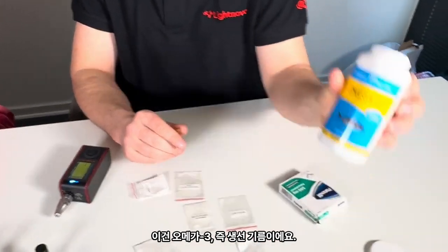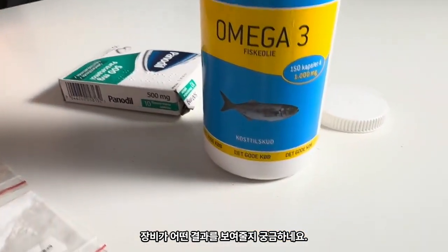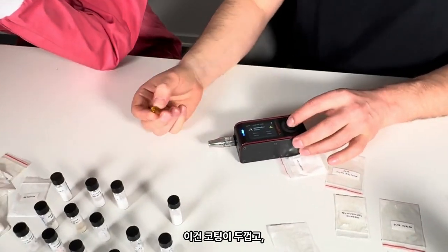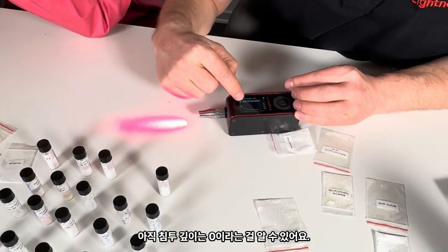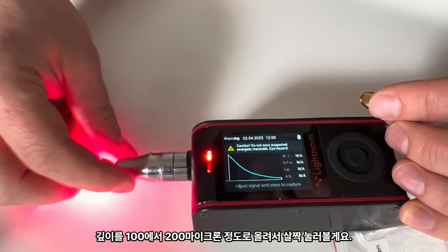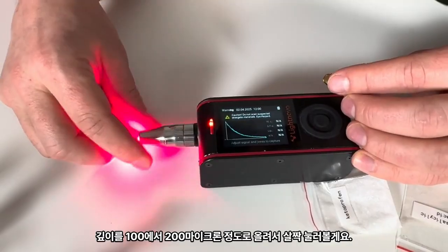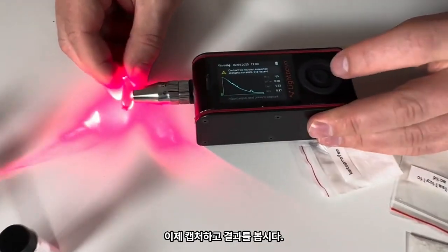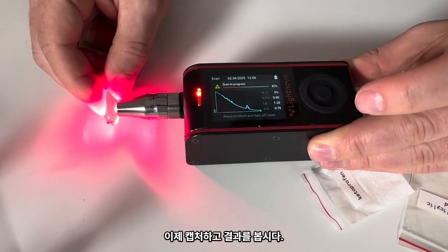It's omega-3. Fish oil? Fish oil, yes. And I'm very curious to see what the device would tell us. So it has some thickness of the coating, and this is 0. We can see by the sapphire peaks we are at 0 penetration depth, and I move in depth, from 100 microns up to 200 microns, and just touch it like that. Let's capture and see.